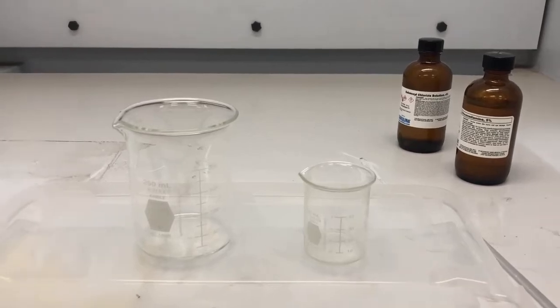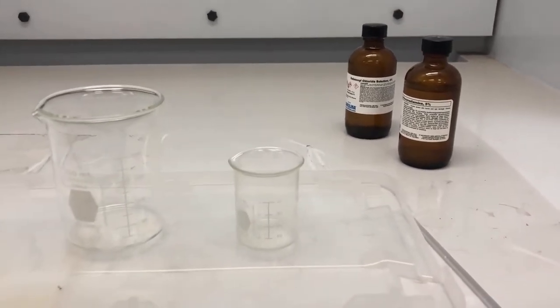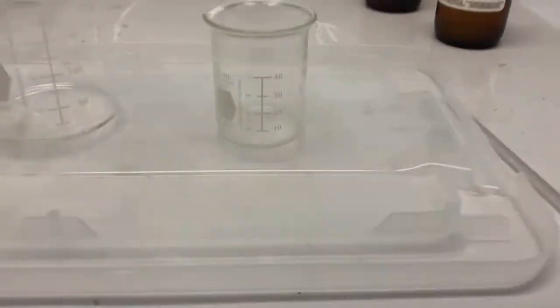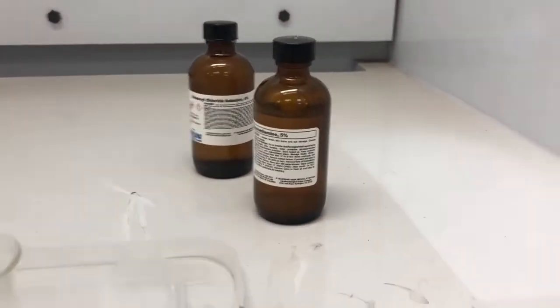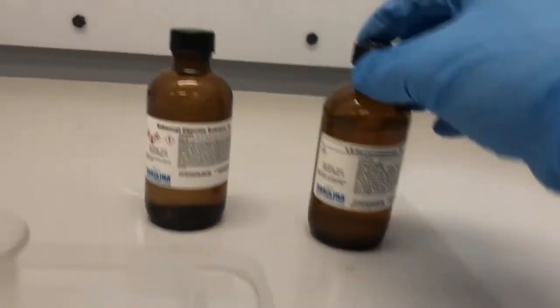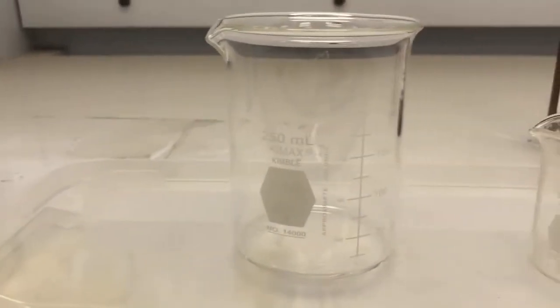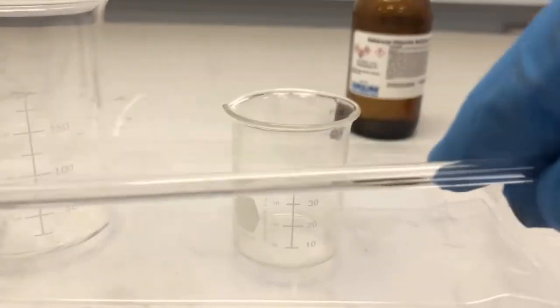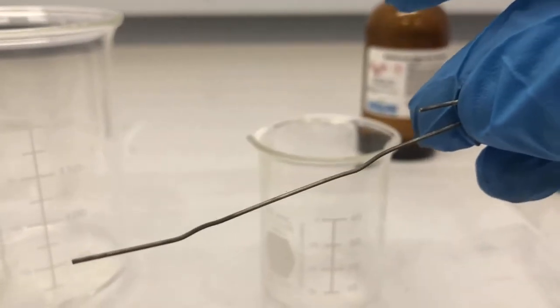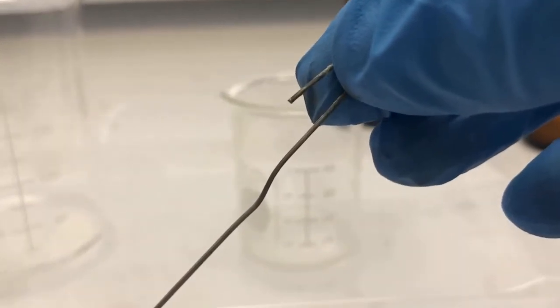All right, everyone, we are back and we are going to start and create our nylon synthesis. So I have my graduated beakers here. I'm working in secondary containment, if you can see. I also have my bottles here, right in here and here. Gloves on, of course. I can put these in a secondary containment, but I'll mix it over here. I also have the glass rod, which we will utilize to roll our nylon rope, and my nifty hook to grab that first strand. If you look here, there's corrosion. Again, that's due to that acid, that byproduct, that HCl.